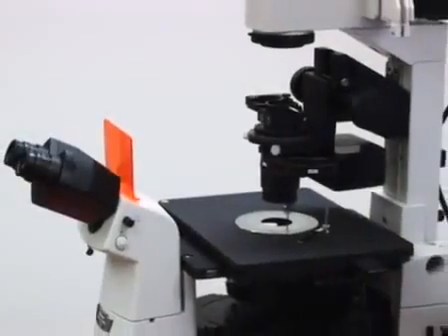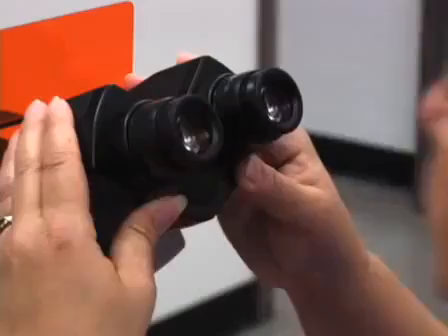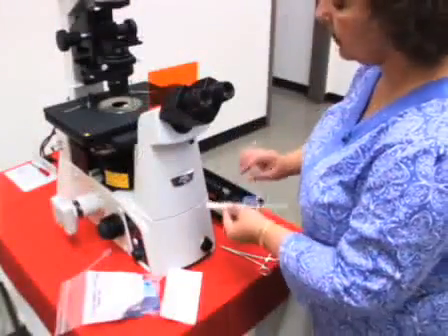Keeping your microscope optics clean is important for high quality imaging. Dust, fingerprints, excess immersion oil, or mounting mediums on or in a microscope cause reduction in contrast and resolution. Today we'll show you important steps for keeping the microscope clean.